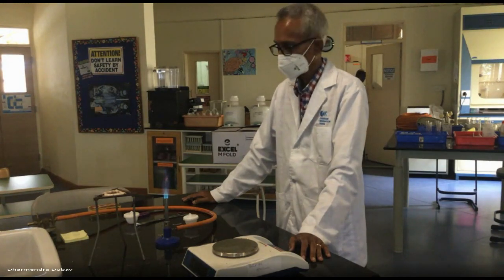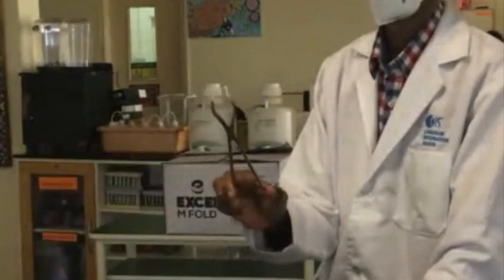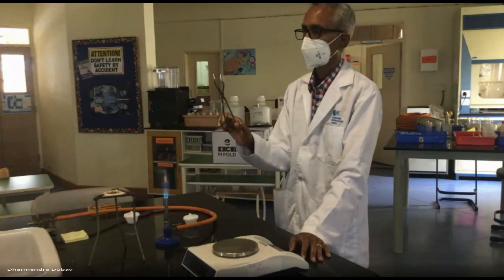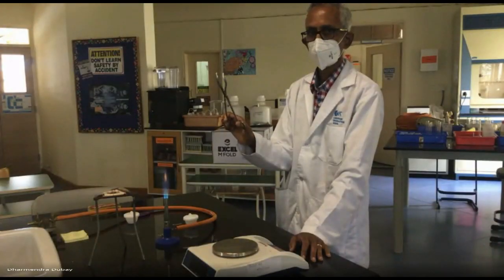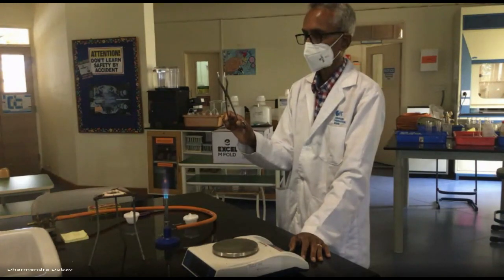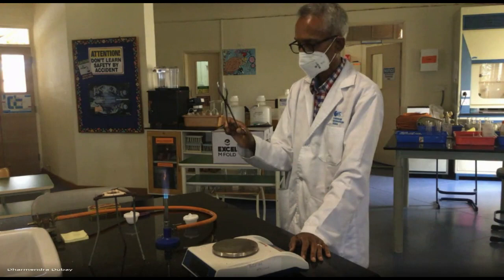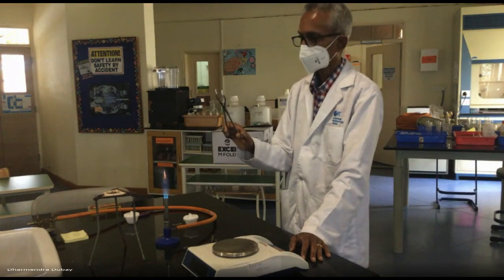And Mr. Ranjan also has the tongs there. If he holds it up, if you notice at the tip of it, what's that at the tip? What's the product? Magnesium oxide. That's magnesium oxide. So, magnesium oxide is going to be sitting there, some of it on the tongs, some of it in the air. So, we would be having a certain kind of experimental error. What type of experimental error are we building if we go about this this way?